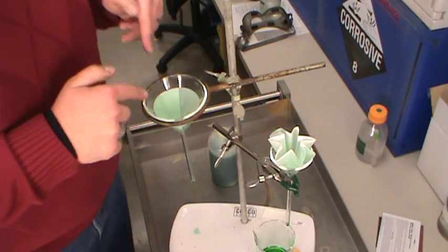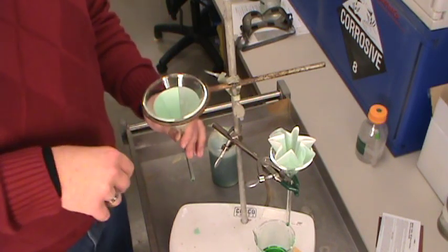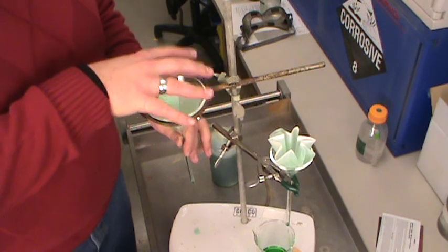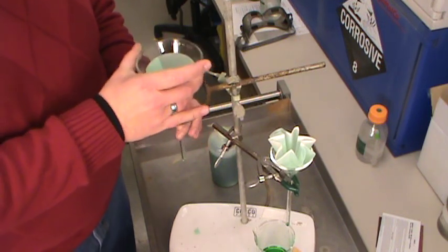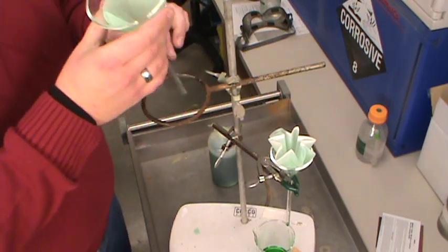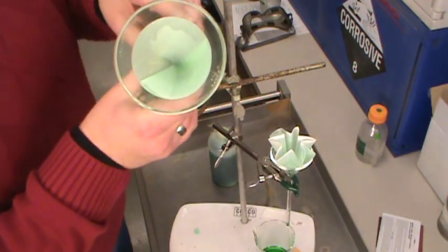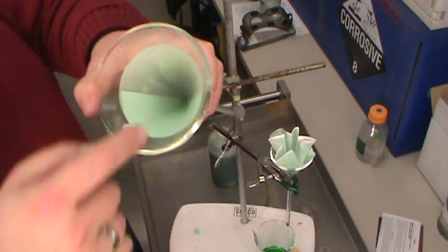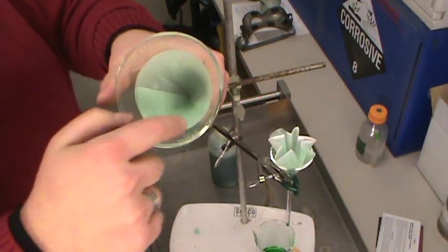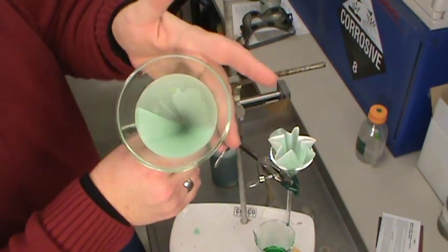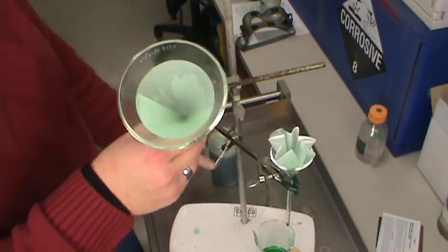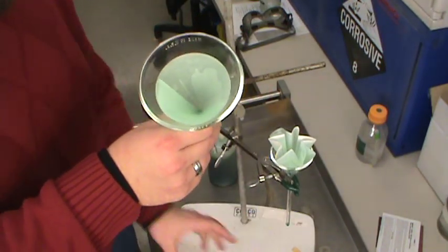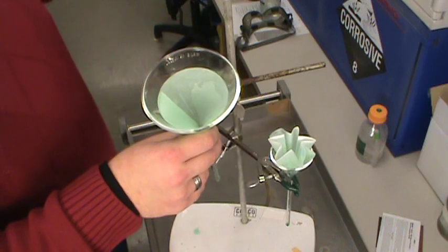Whether you're looking at fluted or at flat filter paper, either one of them works fine. One of the advantages of the quarter fold filter paper is if you fold it right - now here we can see the reason for leaving that one arm a little bit shorter. If you fold it right, you can see that the entire top edge of this has sealed down - once it's wet has sealed down to the inside of the funnel.